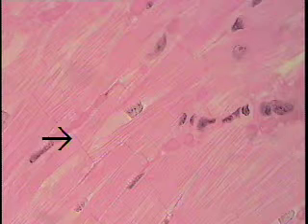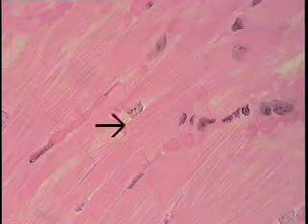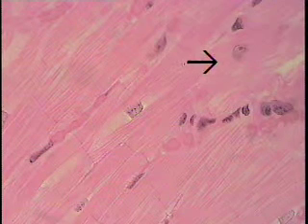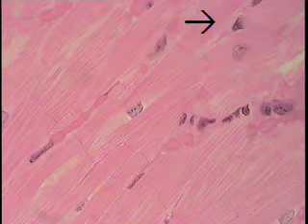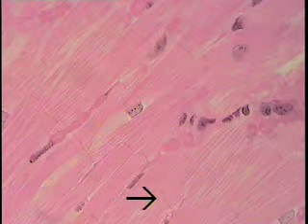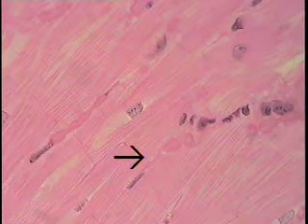On the other end, one can see an intercalated disc here as well, uniting this particular cardiac muscle cell with its neighbor here. These discs, where the branching occurs, unite it to an adjacent cardiac muscle cell here, and another one shown here that's cut obliquely and leaving the field of view. As one looks without moving the field, scattered within the field, you can see portions of other cardiac muscle cells identified by the position of their intercalated discs, as indicated by the arrow.